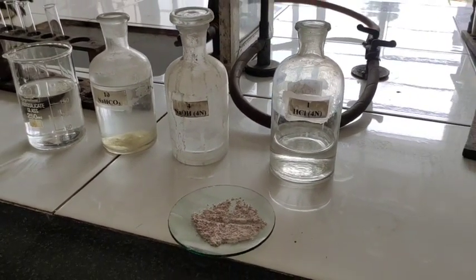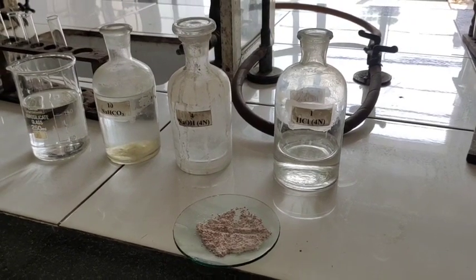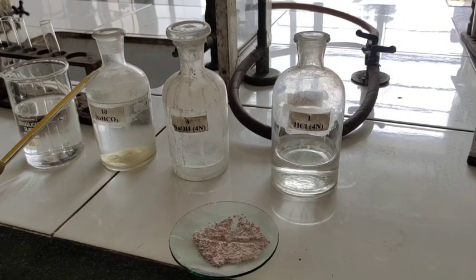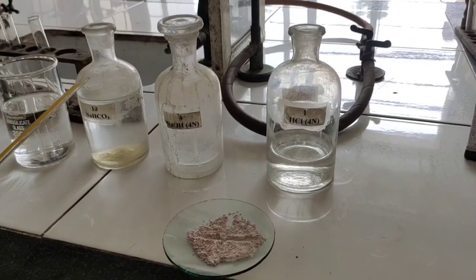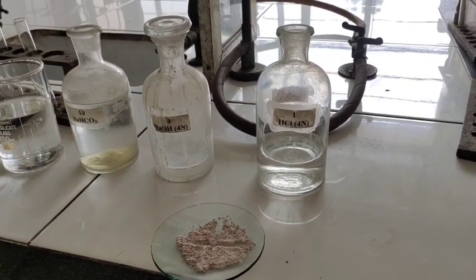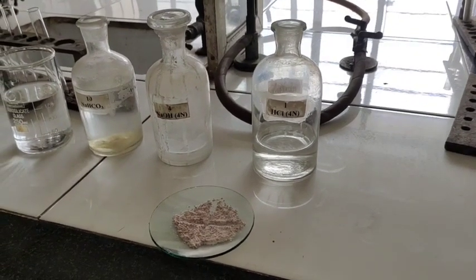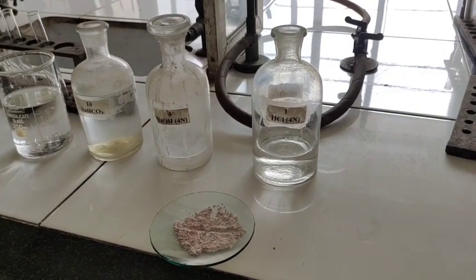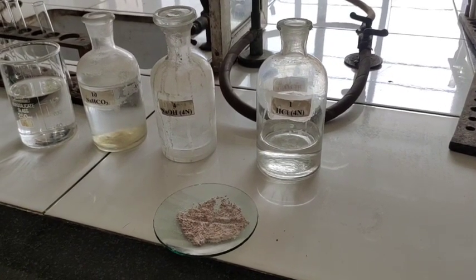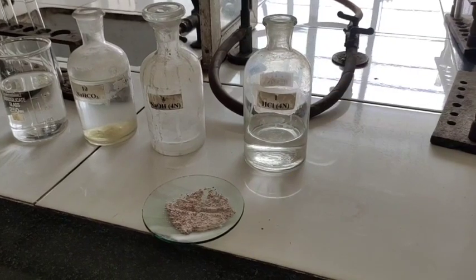Let us see their purposes. Water is for solubility. Sodium bicarbonate is for carboxylic acids or even sulfonic acids — but sulfonic acids are ruled out in our syllabus. Sodium hydroxide is for phenols — why? Because phenols are also known as carbolic acids. And HCl is for bases.